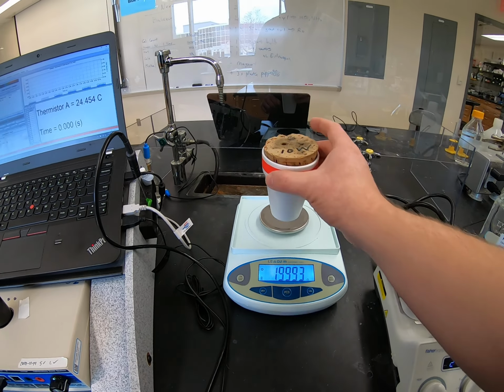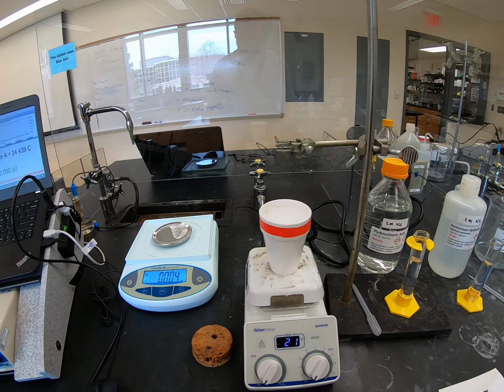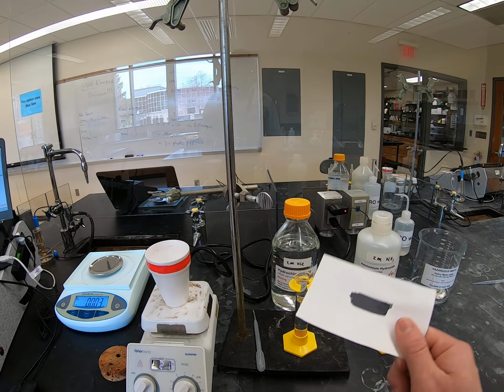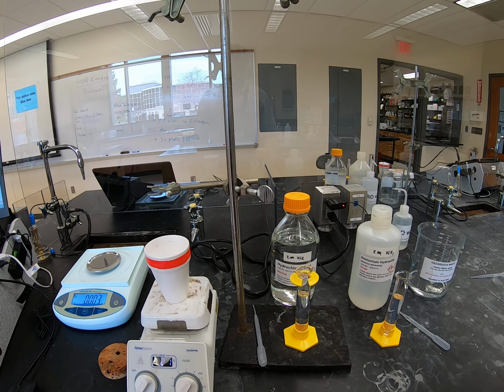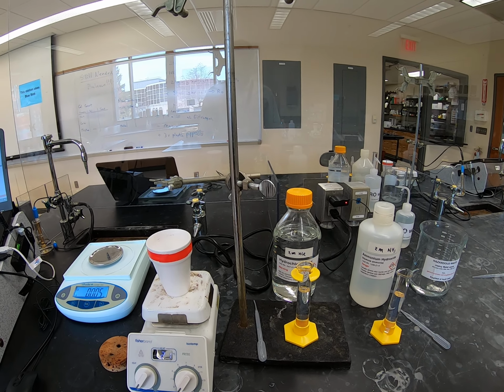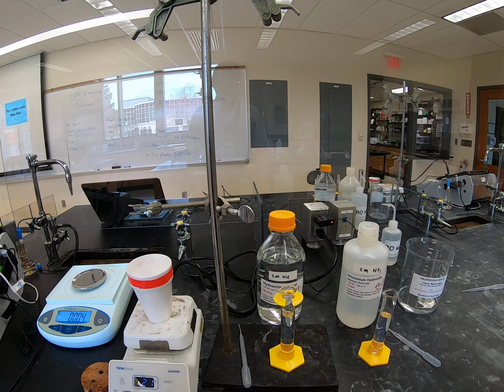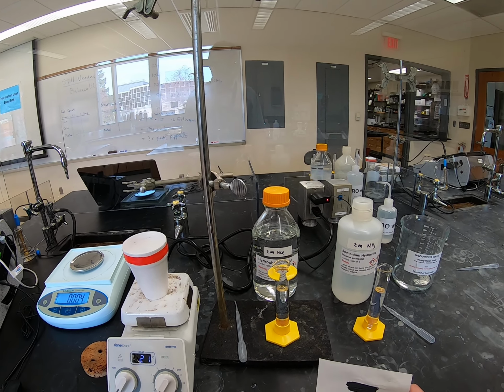Okay, now we're going to put this guy up here. Set the cork off to the side till we're ready. Now, you might notice that I did not use exactly 25 milliliters of each thing last time, and that is to provide a little bit of variability because everybody needs to estimate the volume. So I am intentionally not using exactly 25.0 milliliters in each case, that you have to estimate the volume of hydrochloric acid and ammonia that we're using.